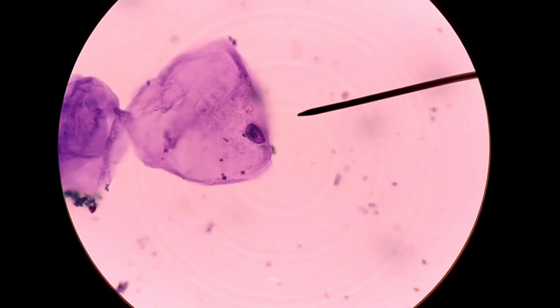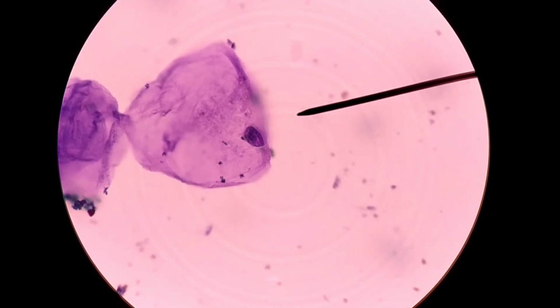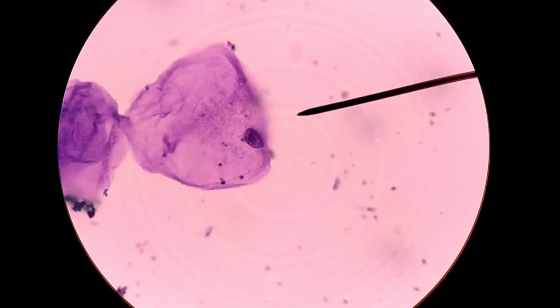The number of bacteria in your mouth is easily more than all the humans on Earth. You have well over 10 billion bacteria inhabiting your mouth, and the populations go up and down as you brush your teeth and use rinses like mouthwash and floss your teeth and all that. But this is a pretty good example of a cheek cell, and it's been simple stained with methylene blue. And so there you have it.